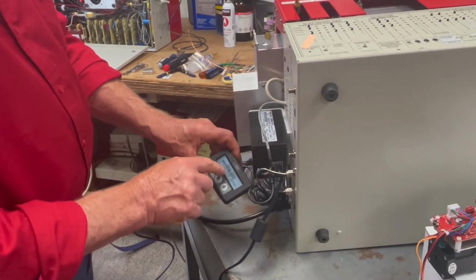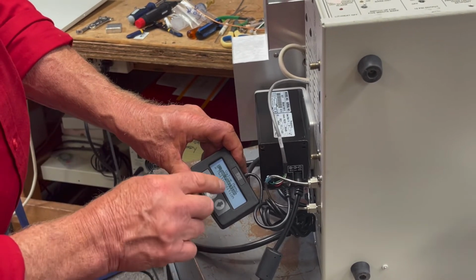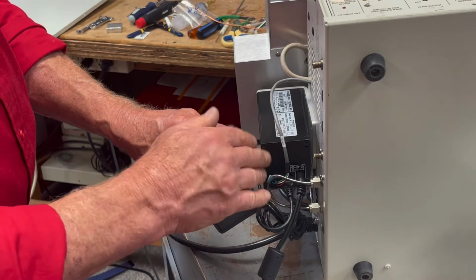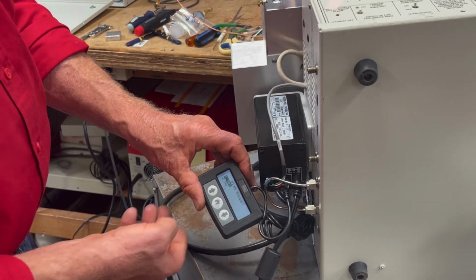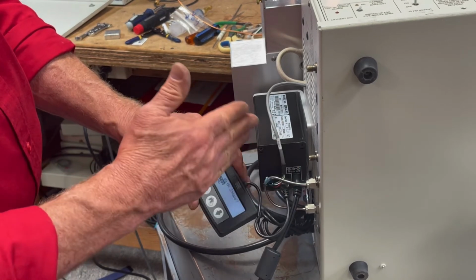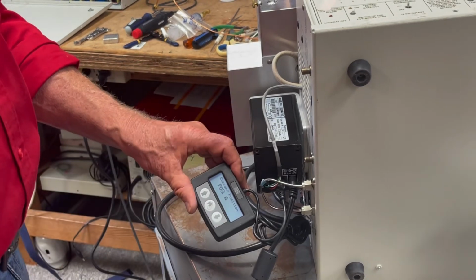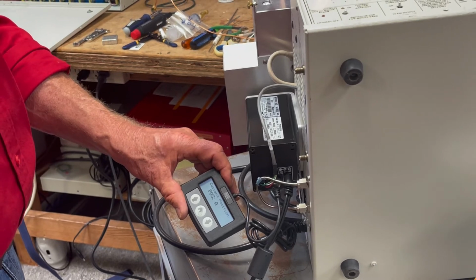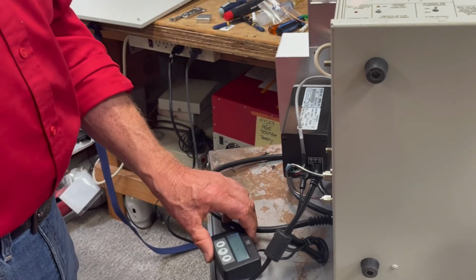So what you want to do here is valve setup. So you hit OK, you hit home again, and then it wants to know, is it a two position valve, which it is, or is it a multi position valve, which is different. These are just two positions, one way or the other. So you say yes, and then with stops, yes, because that's what we want it to do, is figure out where the stops are on the valve. And then you hit OK, and then it goes through its little learning routine. It's a little louder, but that was quicker. Anyway, this is how you configure it.